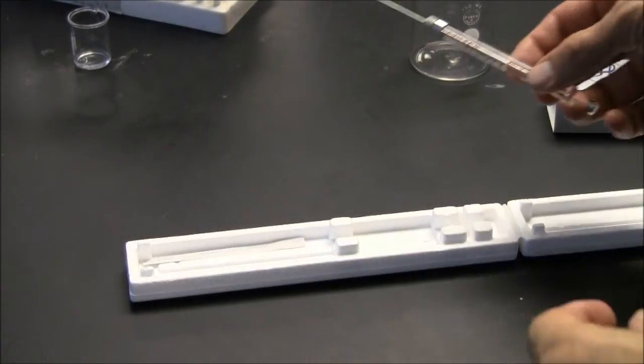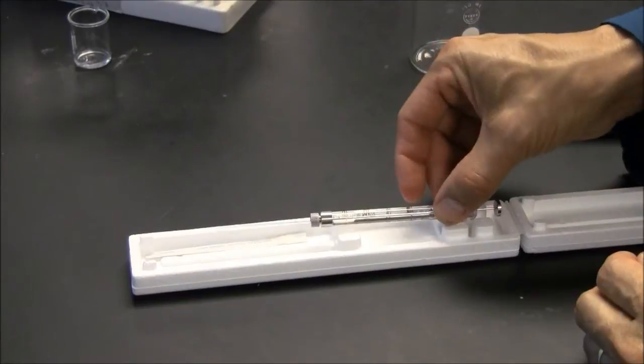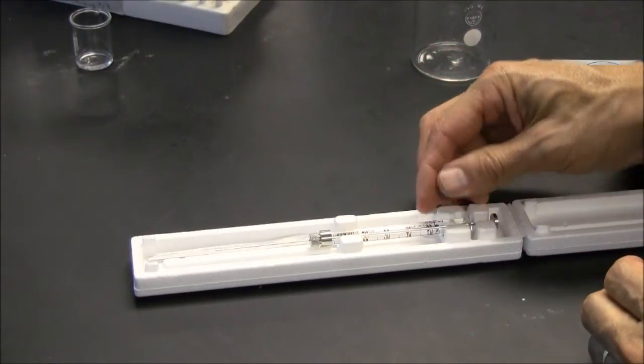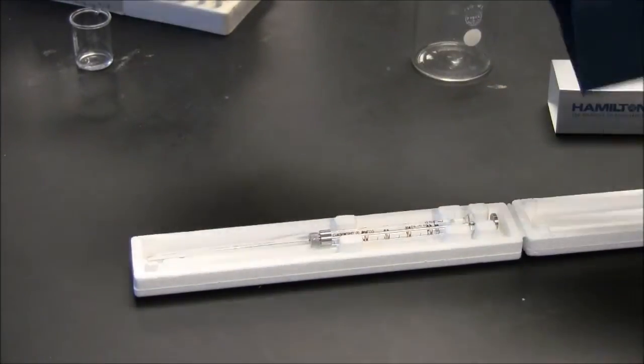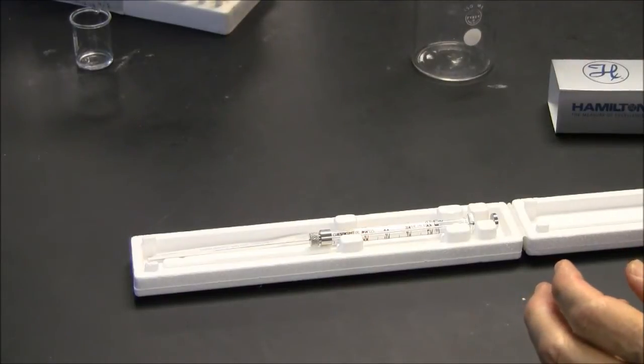After your final rinse with acetone, put it back in the styrofoam container. Acetone itself will dissolve the styrofoam, to make sure it's not dripping with acetone when you put it back.